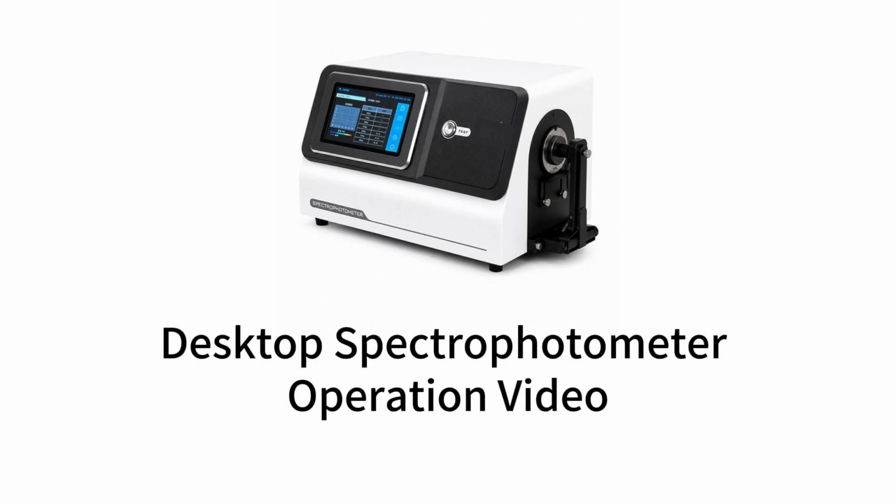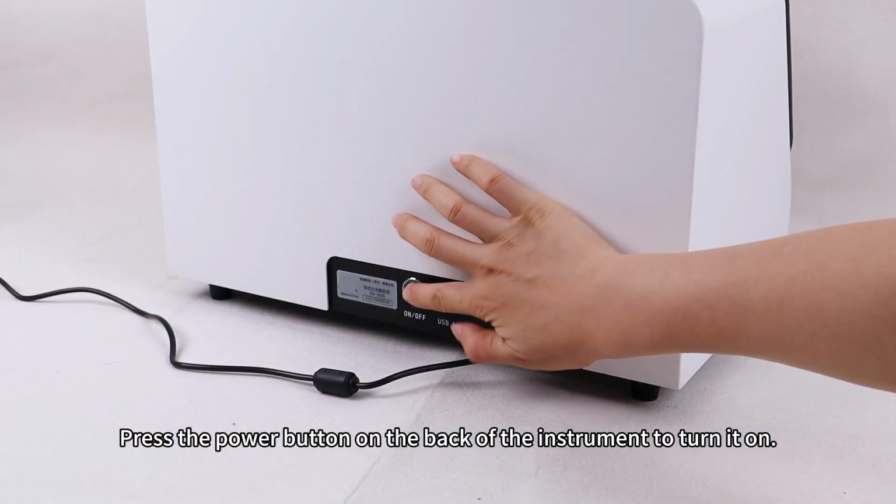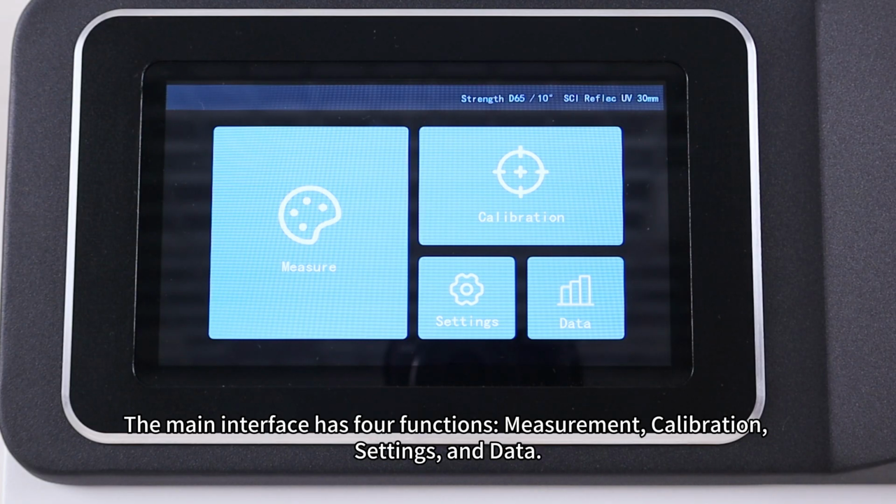Desktop spectrophotometer operation video. 1. Power on and calibration. Power on. Press the power button on the back of the instrument to turn it on. The main interface has four functions: measurement, calibration, settings, and data.